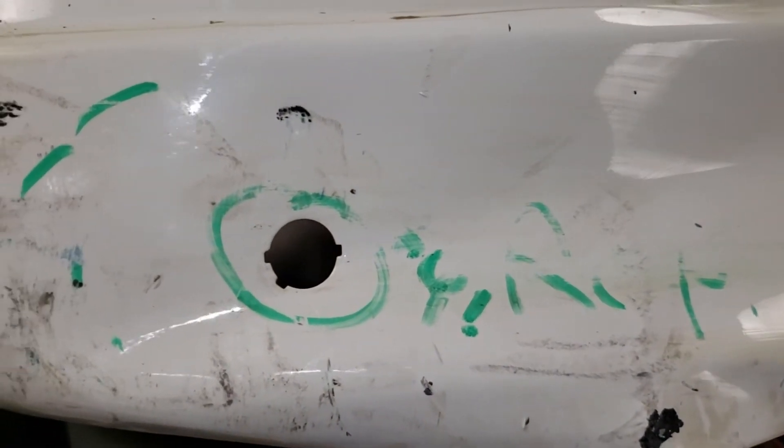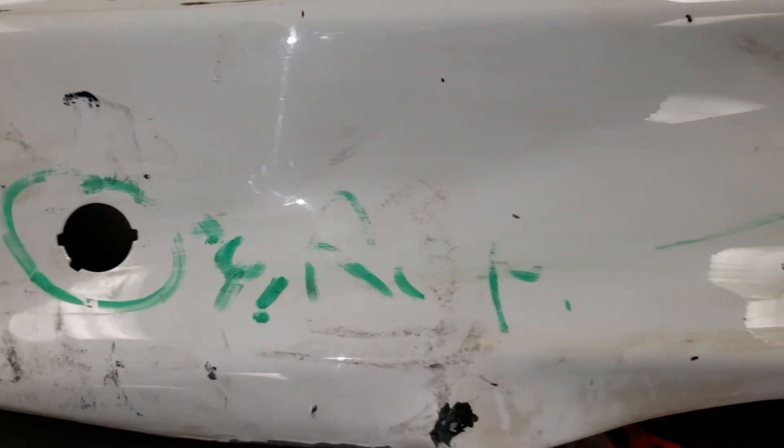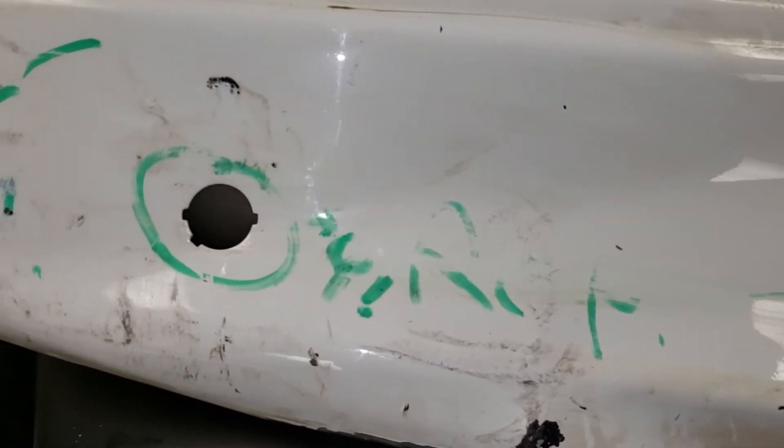In your description of this white bumper, please disregard the green marks. These were placed by the collision center where we obtained this item.